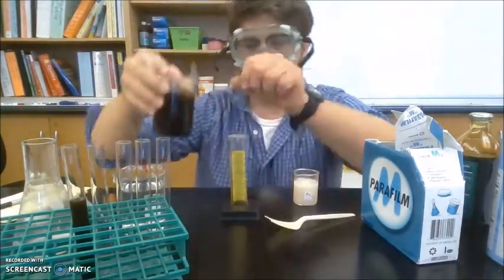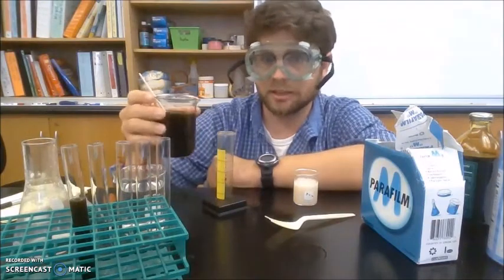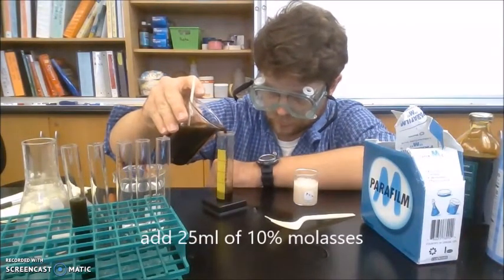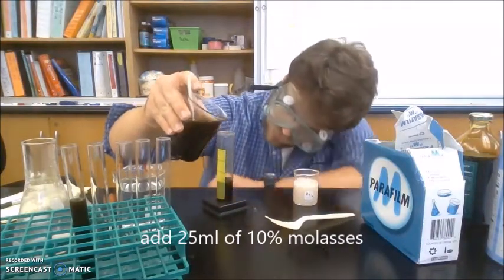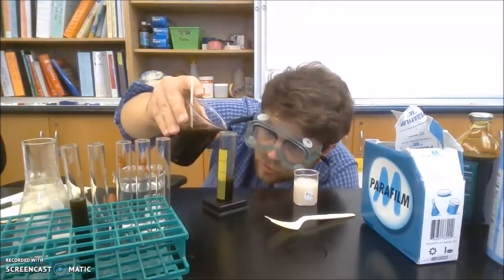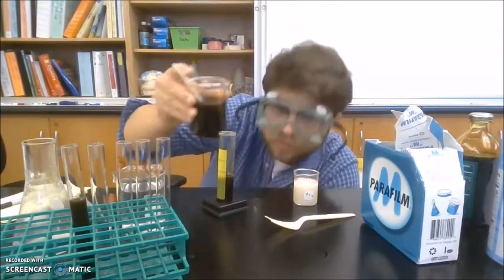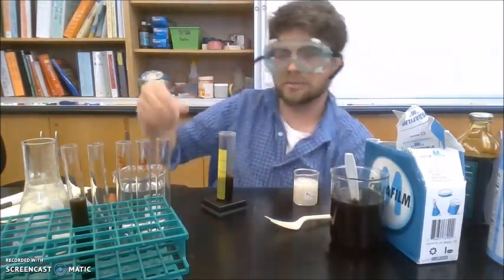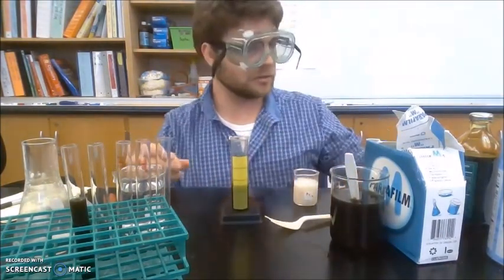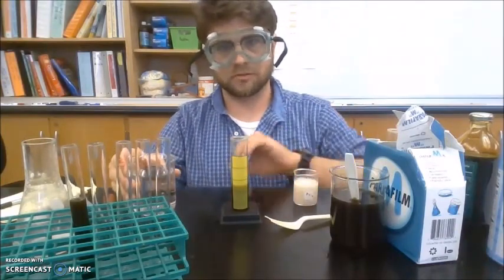So starting with 10%, I'm going to add 25 milliliters. So let's get to eye level and make sure I'm even. Looks good. I'm at 25. Now, to dilute it, I'm going to add 25 milliliters of water.